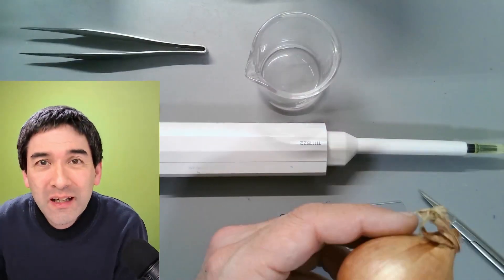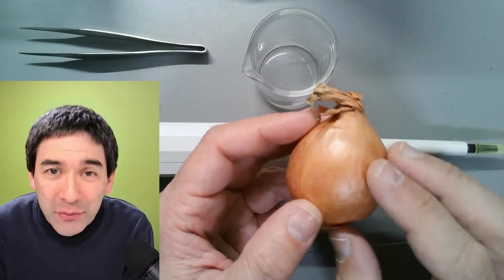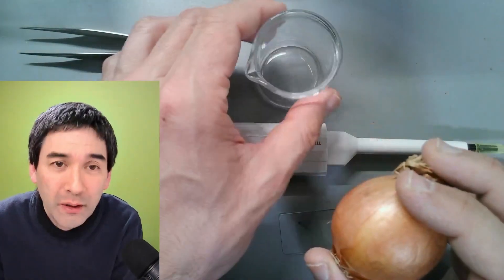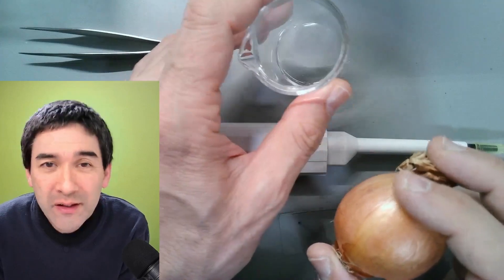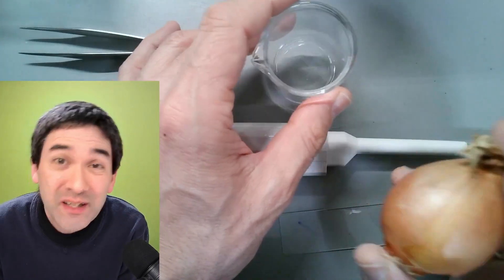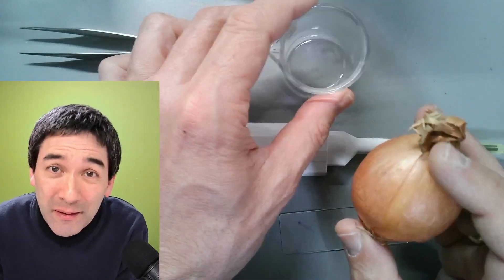We're going to be using not water as a mounting medium but rather vegetable oil. Just regular cooking oil is enough and I will show you how to do that. It's a fairly simple preparation.